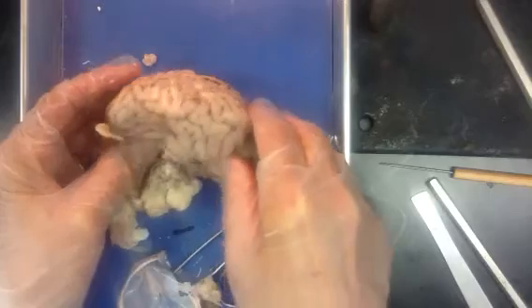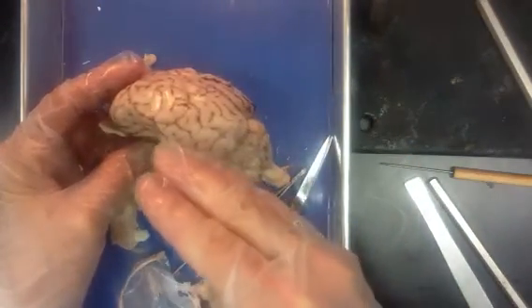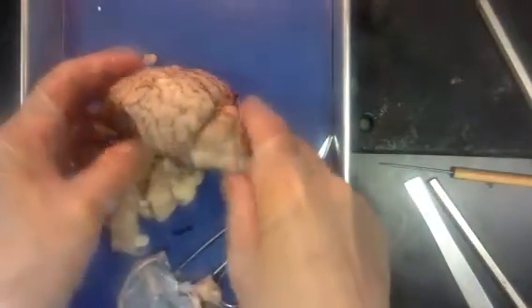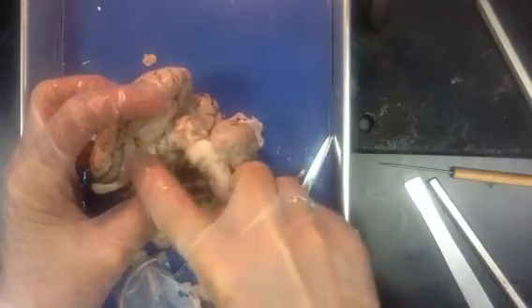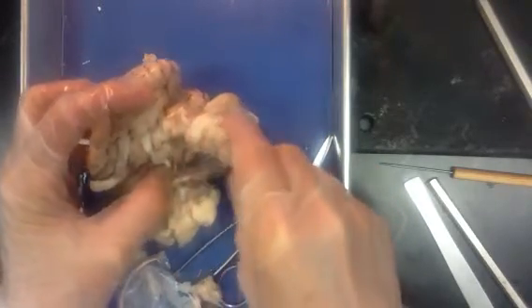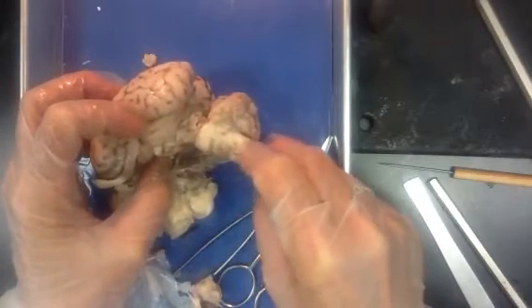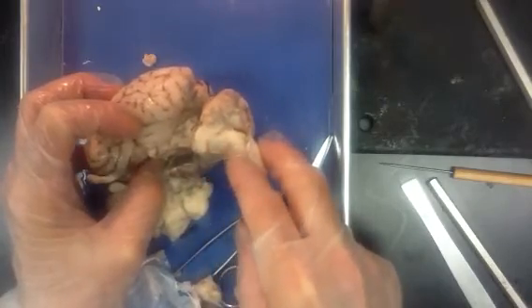We call this area where there are these folds and grooves the cortex. The cortex kind of grows up like a stem, comes up like a flower, and the petals fold down around that brain stem again. This brain stem, which we'll take a look at when we do a sagittal section, the lowest part is referred to as the medulla oblongata.